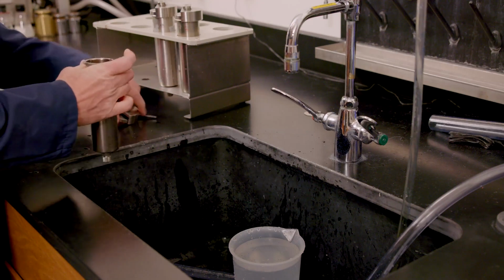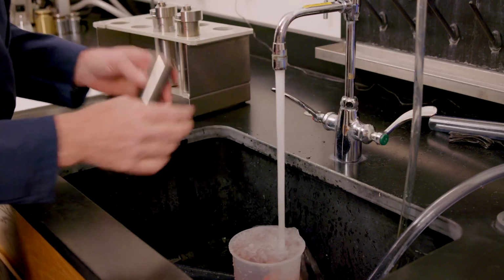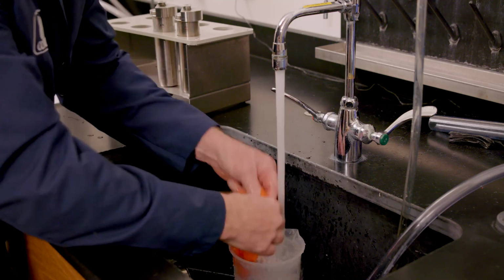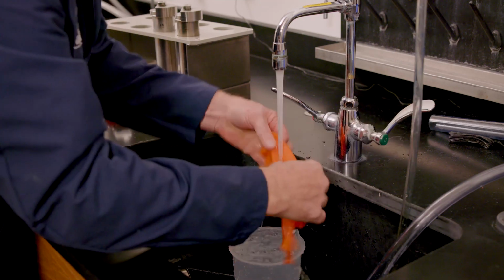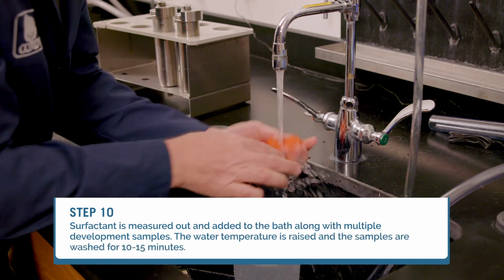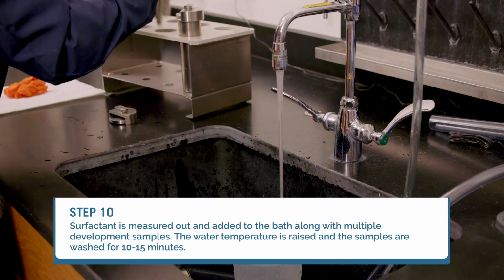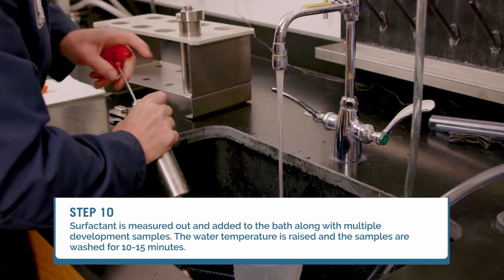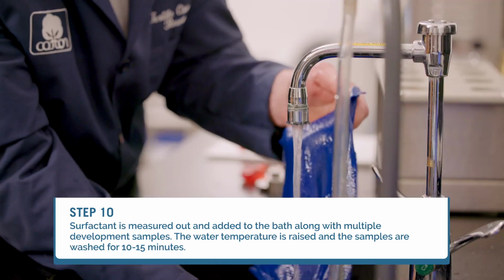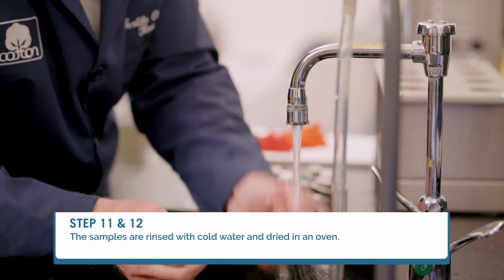Once the dye cycle is complete, the samples are soaped off or washed to remove excess chemistry and unfixed dye. Typically done in a sample rotary machine, surfactant is measured out and added to the bath along with multiple development samples. The water temperature is raised and the samples are washed for 10 to 15 minutes. Finally, the samples are rinsed with cold water and dried in an oven.